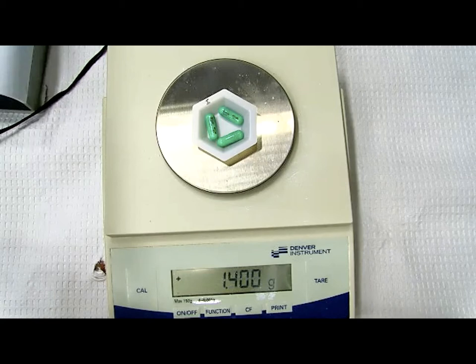1,399. Oh, I like that number. I saw it, did you see it? Let's do 1,400. So 1,400 milligrams. That'll make life a little bit easier maybe, okay? Did you get that written down? Wait a minute, that's wrong. Oh no, you're going to have to erase that. That's not the right number.